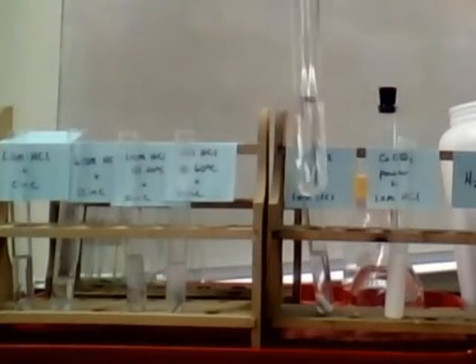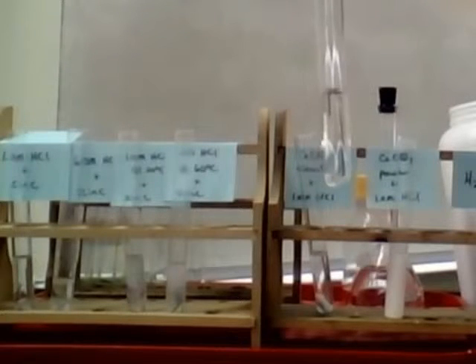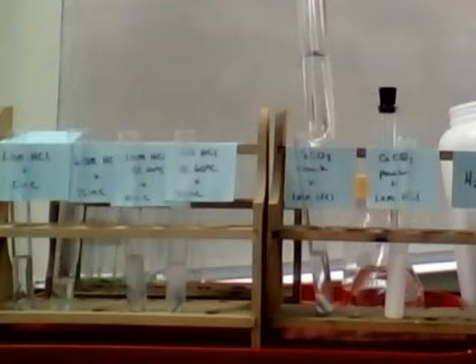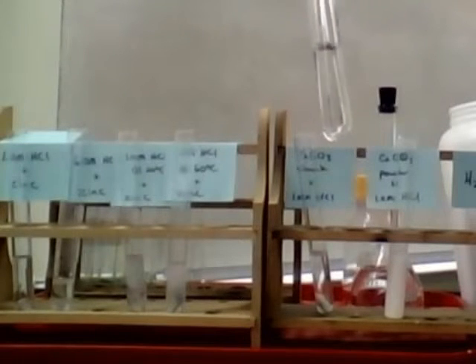And lastly, we've got the effect of a catalyst. So this is hydrogen peroxide. It looks kind of like water, but it's H2O2. It is mixed in with water, but there's hydrogen peroxide there. And so hydrogen peroxide actually will decompose into water and oxygen. So it goes from H2O2 to H2O and then O2.